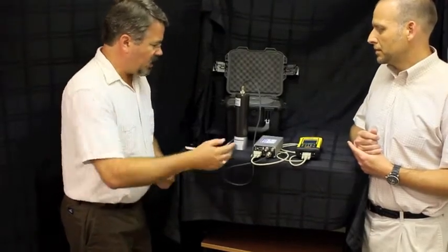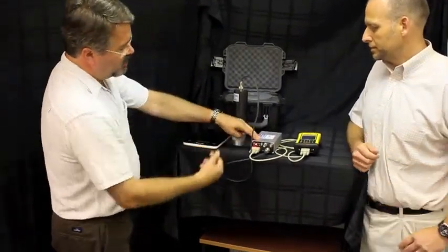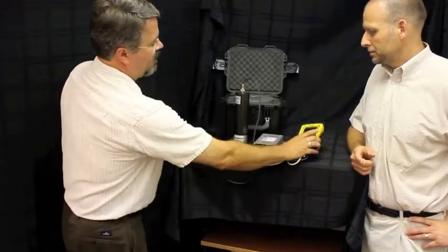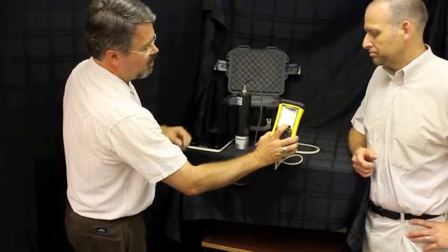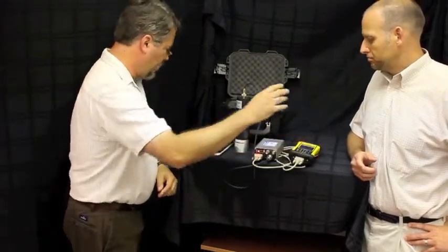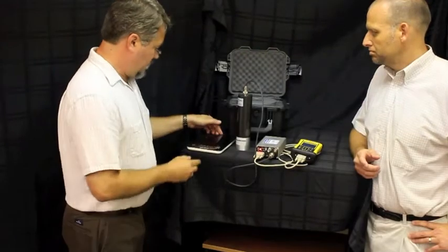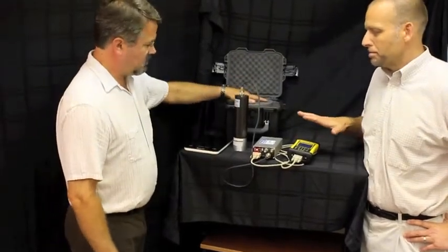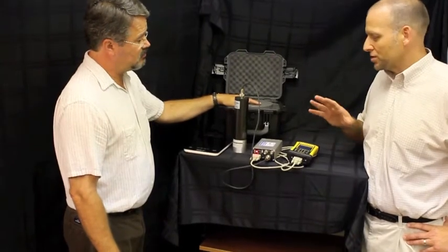You would go ahead and apply power to the analyzer and make sure that we have power on for our mobile PC. And these are both battery powered devices, but if we're in an office or to charge them, we would put them up to wall power, to AC.